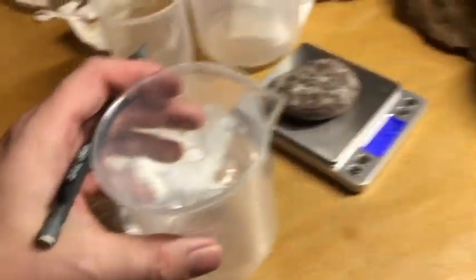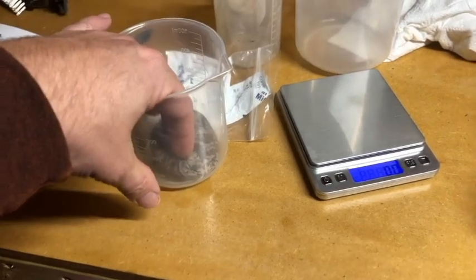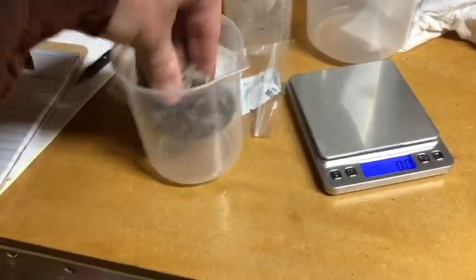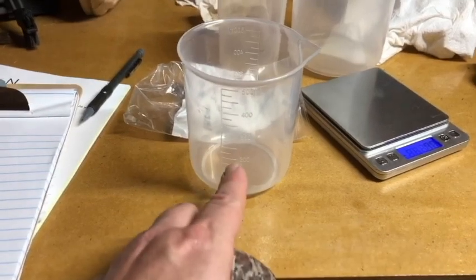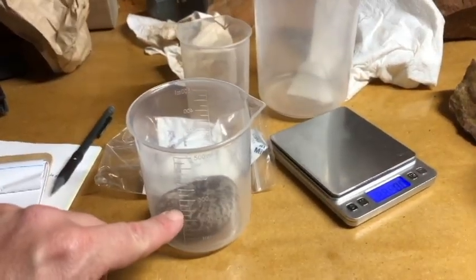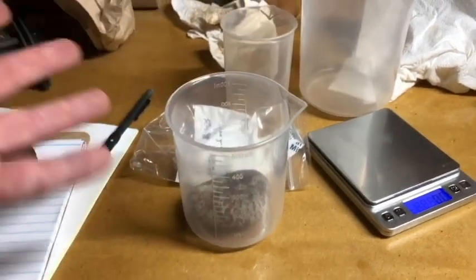So now what I'm going to do is take what I'll call volume initial, which will be an amount of water that I put in here to make sure this gets totally covered. I've done this before. The water will get poured first, a known volume. Then this gets put in. I'm not going to show you this because I need two hands to do this. Say I put in 200 milliliters. That should totally cover this. The water will rise. Say it's 250, right? So I would take the difference, 250 minus 200, 50.